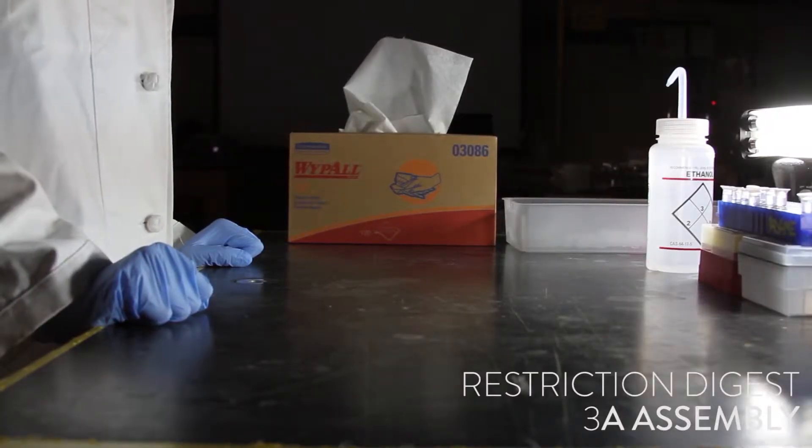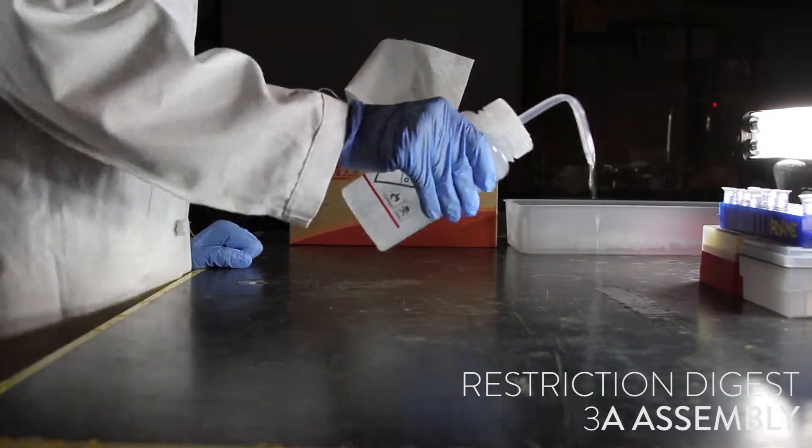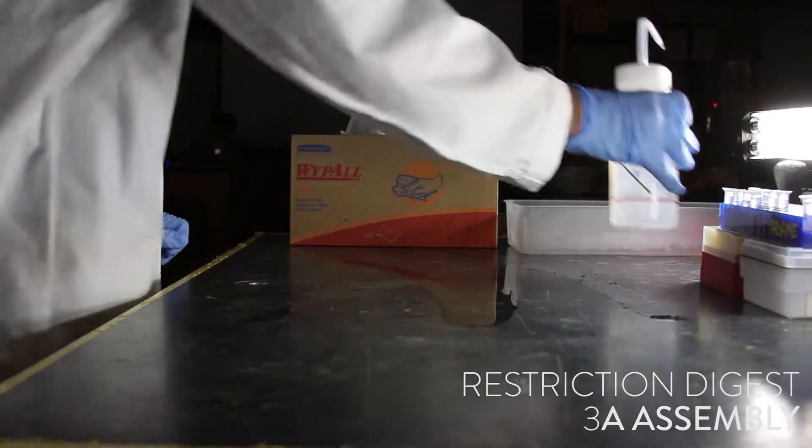Today, we are going to perform Restriction Digest. First, we are going to clean the lab bench by wiping down with 70% ethanol and paper towels.